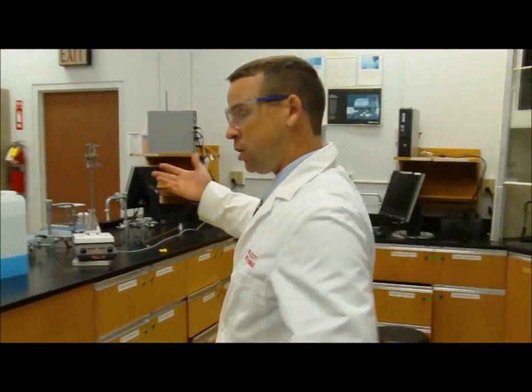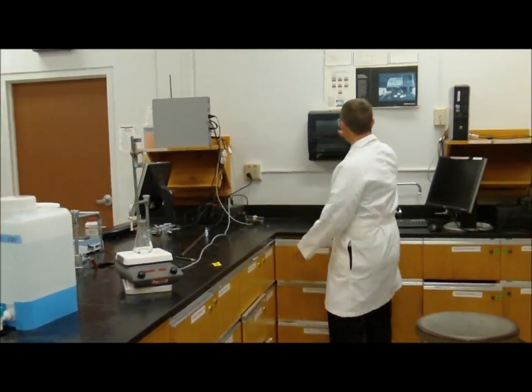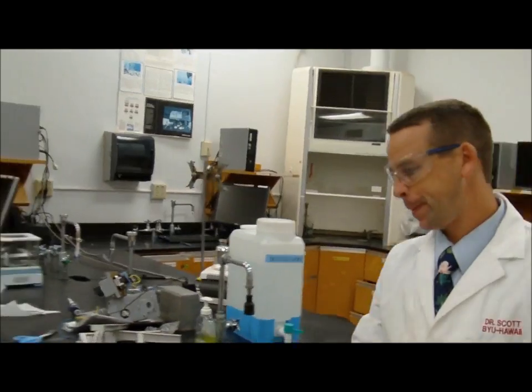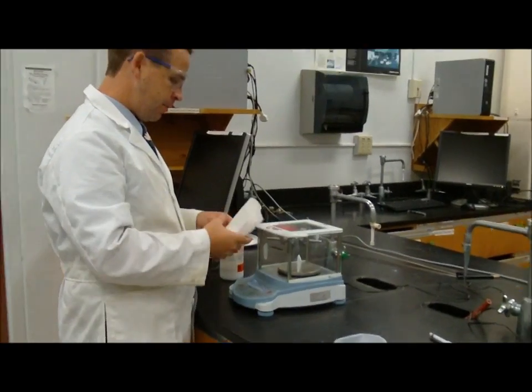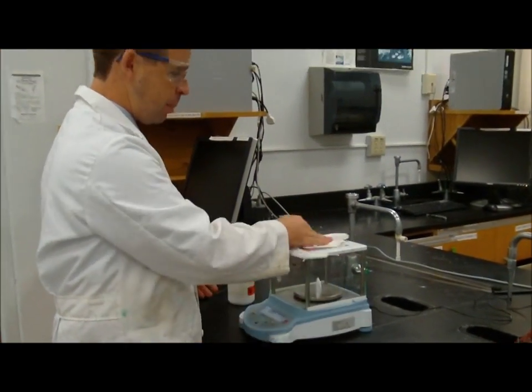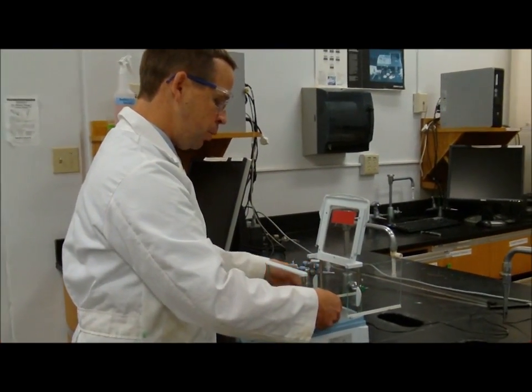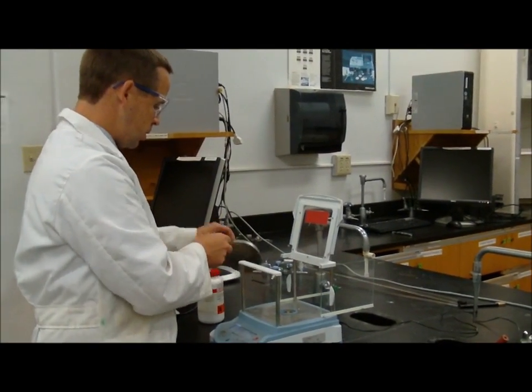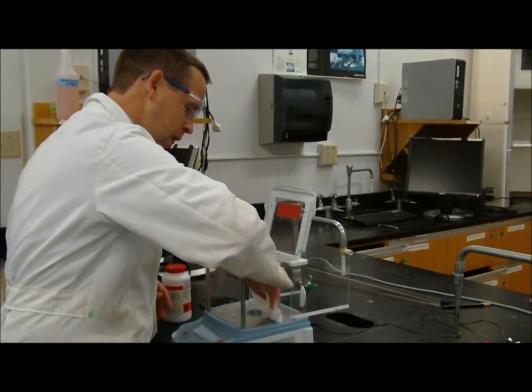After I'm done making the copper sulfate, or using the balance, I want to make sure that I leave the balance nice and clean for the next person. So get myself some paper towels. All right, and I want to clean up the balance. If there's any spilling around the outside, I'll wipe off that. I'll open the doors here, and I can remove the pan very gently by just lifting it up like this, putting it somewhere safe, and then using this as a brush to brush out anything that was spilled.